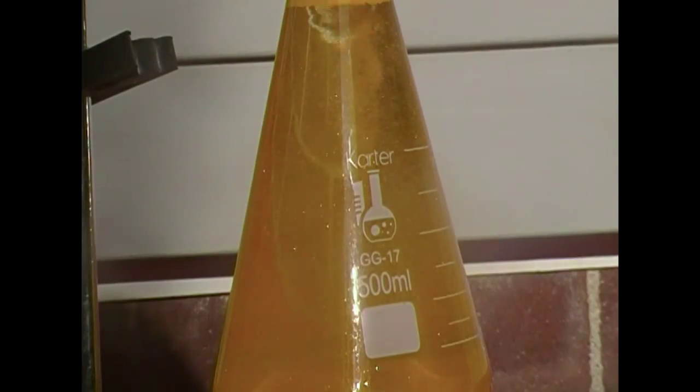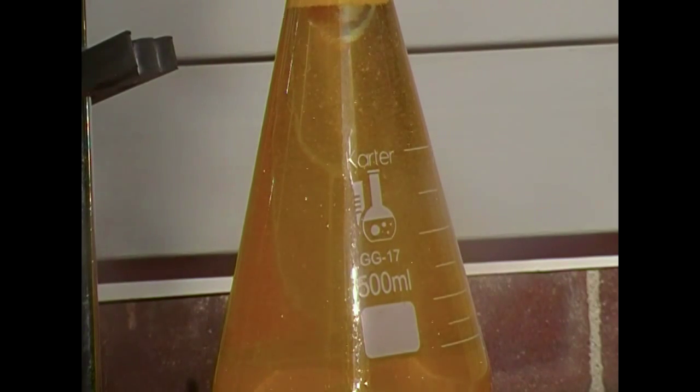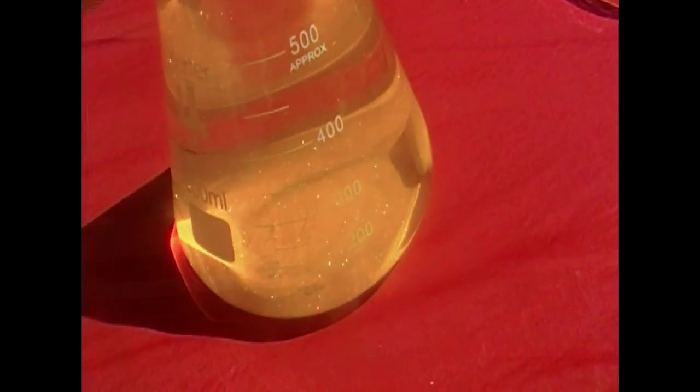There's not much more I can say on this experiment because it's more of just seeing than me speaking about it. So you'll be able to get a full glimpse of the true beauty of the crystals. Again, do not touch this with your bare hands because it can eventually be absorbed into your skin, and lead is a very toxic element, and it's really not good to have that in your system. So please do be careful, and I hope you enjoy the next minute or so of the images I have here.